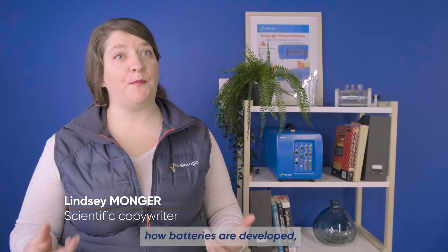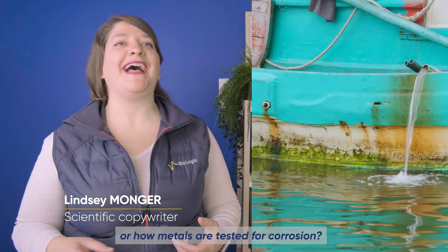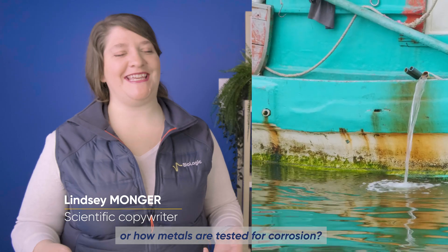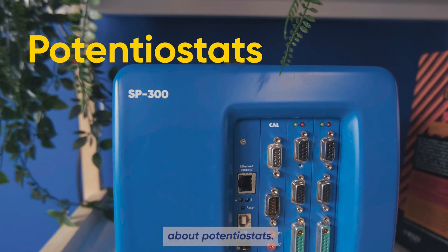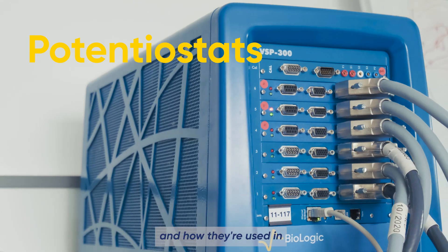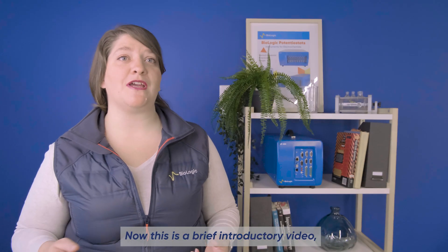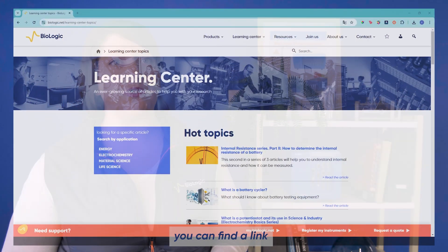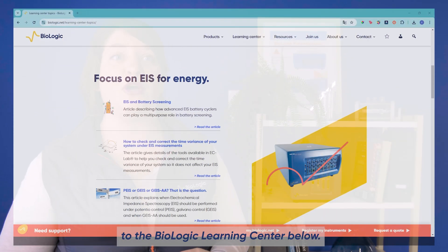Have you ever wondered how batteries are developed or how metals are tested for corrosion? Well in this video we're going to be talking about potentiostats, what they are and how they're used in science and industry. This is a brief introductory video, so if you'd like to learn more you can find a link to the Biologic Learning Center below.